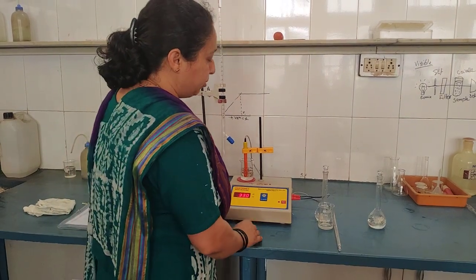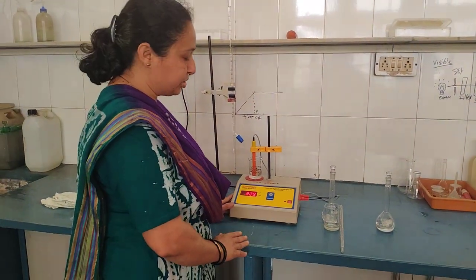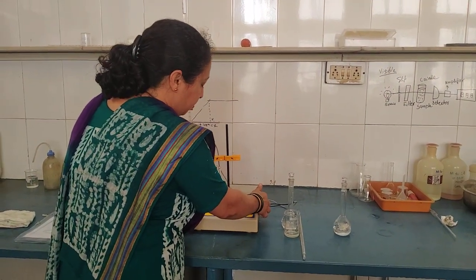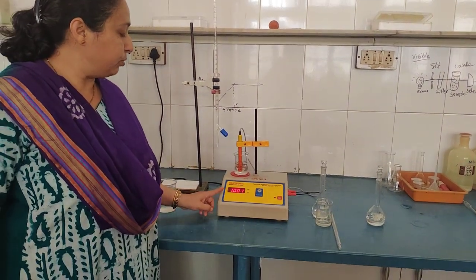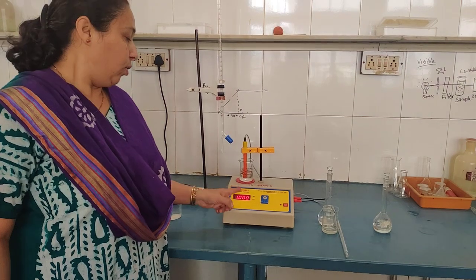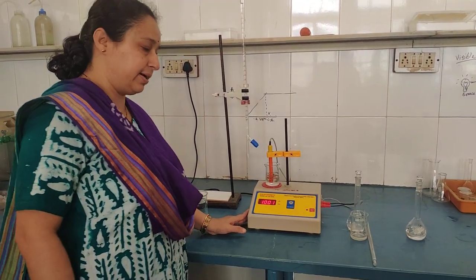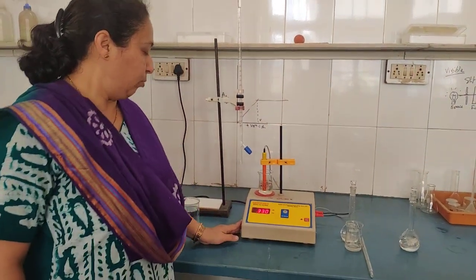Now I will tell you how to standardize it. There is an inbuilt standardization method for the conductometer — just one knob is given. You have to shift to that mode, and your conductometer should give you the reading of 1 on the display, which indicates that your conductometer is standardized. Then shift back to the reading mode.